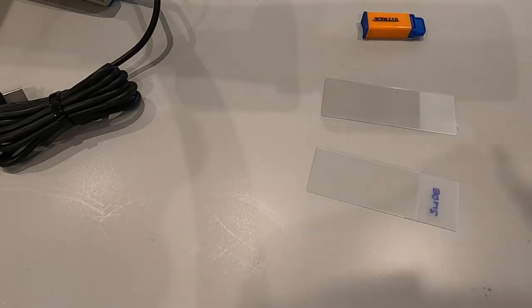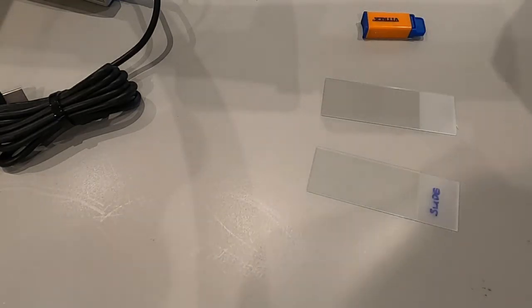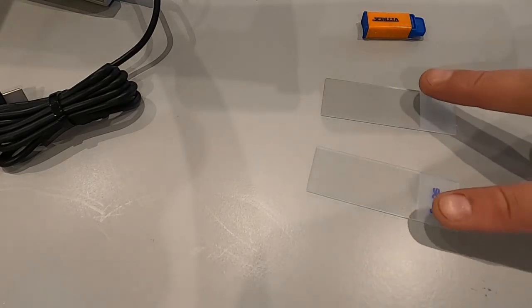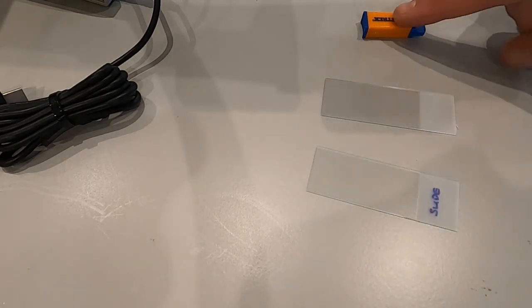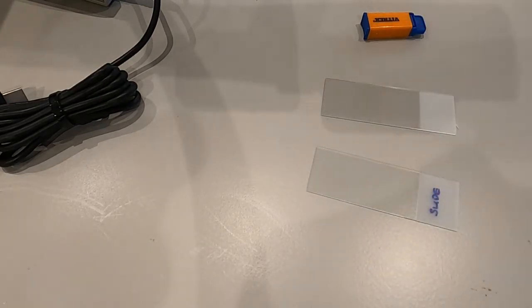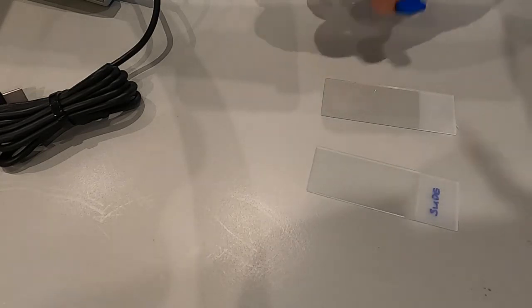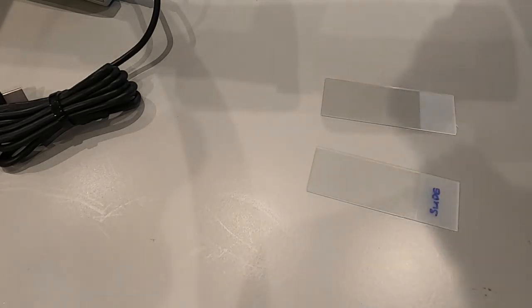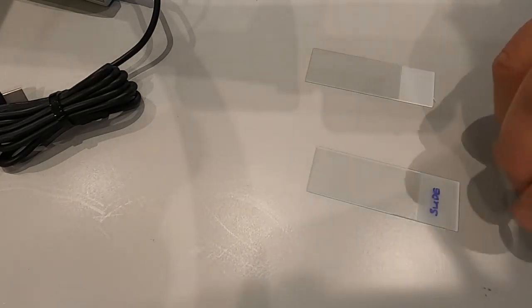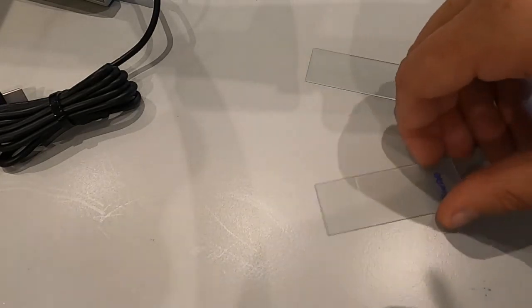The second method is just as easy, using the same equipment: two slides and a skin prick. You'll do exactly the same preparation - twist the cap off and stab yourself.